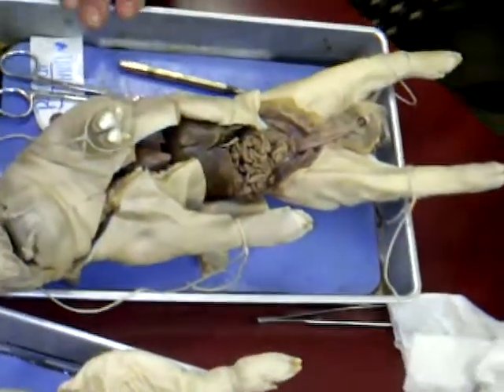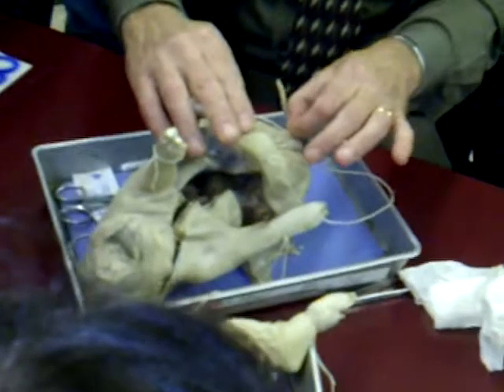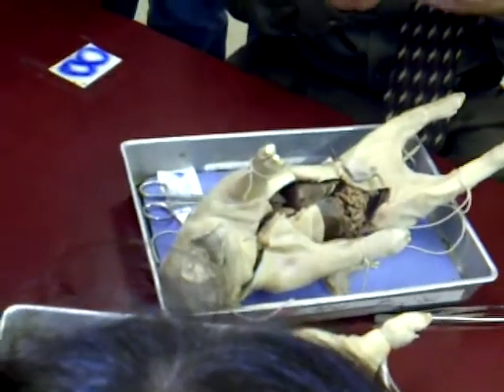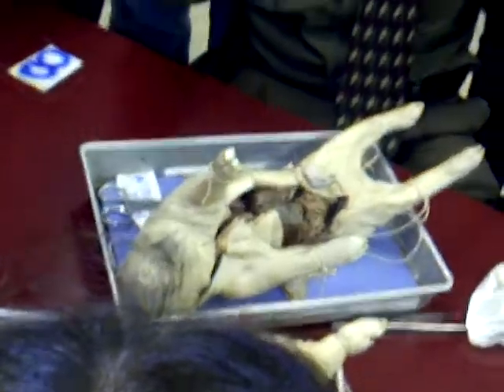The inguinal canals are the canals through which the testes descend and end up in the scrotal sacs, which are sacs of external skin that hang outside the main body cavity, because those last stages of spermatogenesis, when those spermatids have to differentiate into sperm and the DNA gets squeezed down to a very tight package, have to be done at a lower temperature.